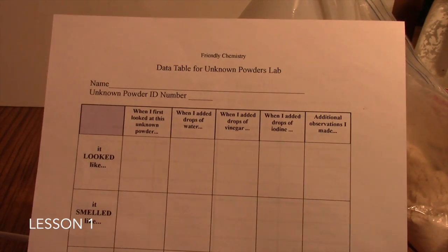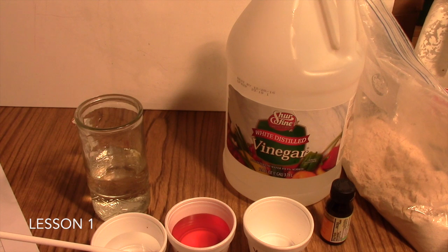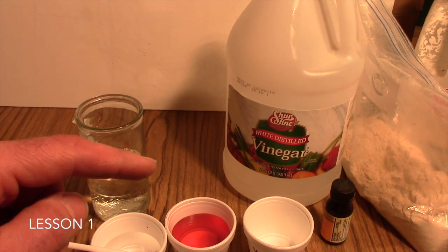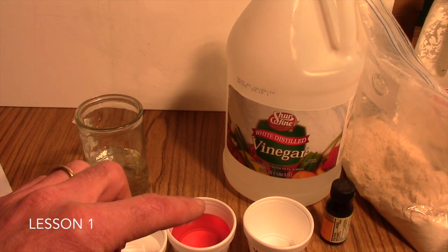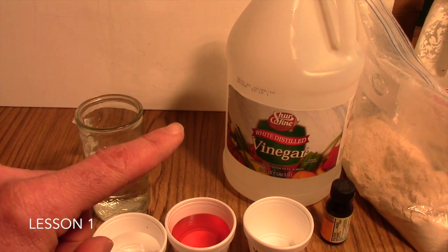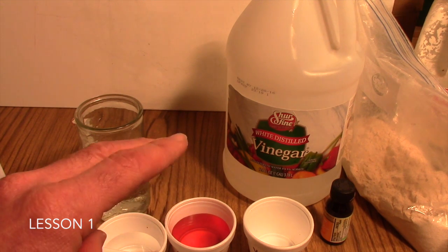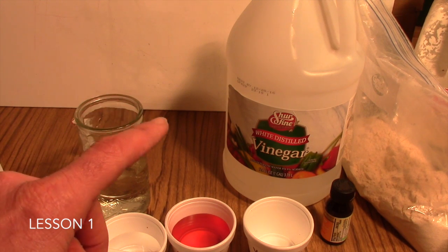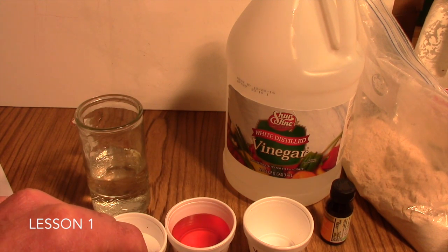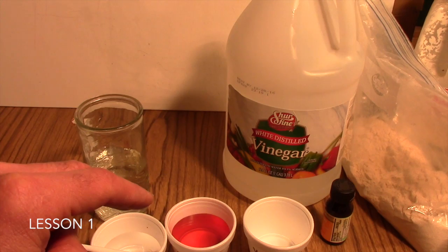However, in some packaging of powdered sugar, they do add cornstarch to it, apparently to prevent caking of the powdered sugar. So if you drop the iodine into that powdered sugar, you will get the positive starch test. You will see the bluish, blackish purple, and that can be kind of confusing, but it can also be an interesting topic to bring up, that maybe there's more than one powder in these powders I provided for you. That can often bring a good bit of discussion into your lab situation.